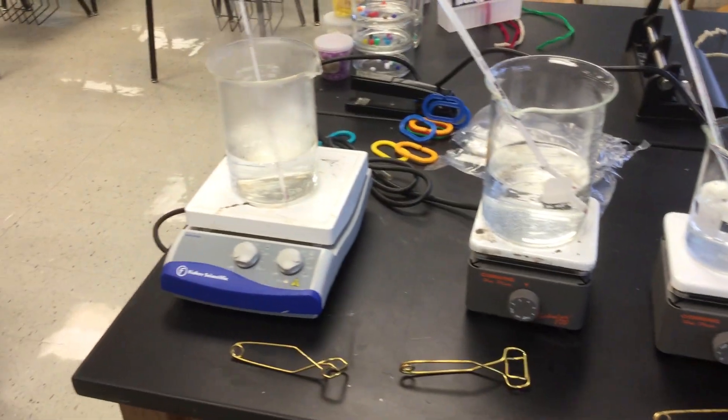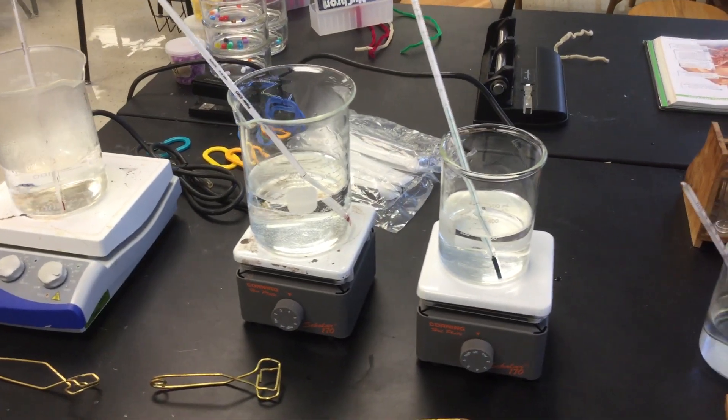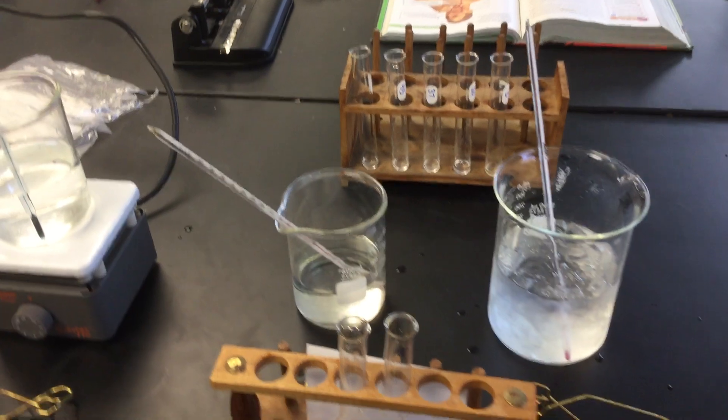Okay, this is the setup for our lab that we are about to perform, measuring the effect of temperature on the enzyme amylase.